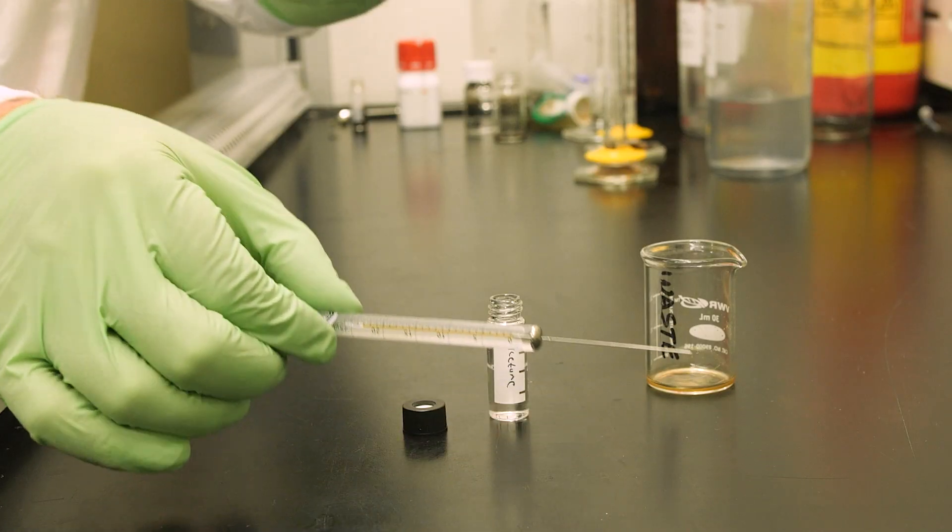Alternatively, you could use a specialized cleaning solution suitable for your syringe. For best cleaning practices, check the instruction materials provided by your syringe manufacturer. But in general, proper syringe cleaning involves the following process.